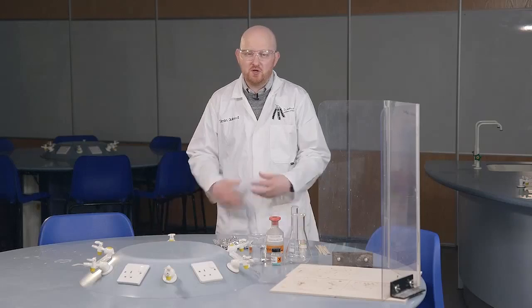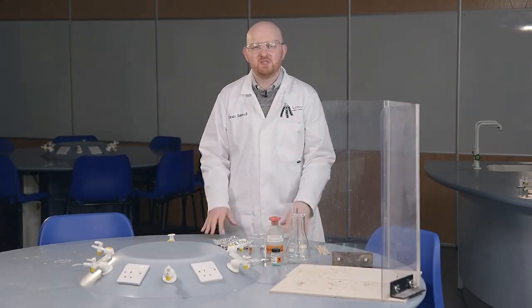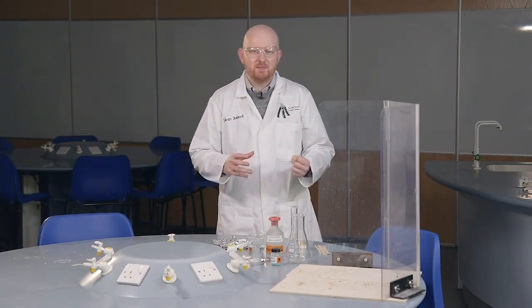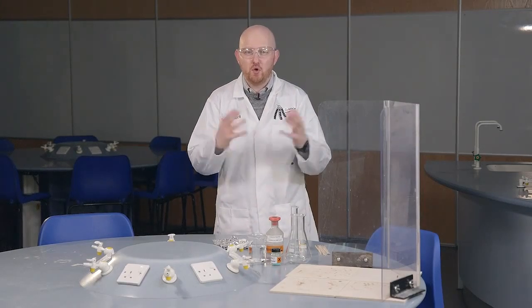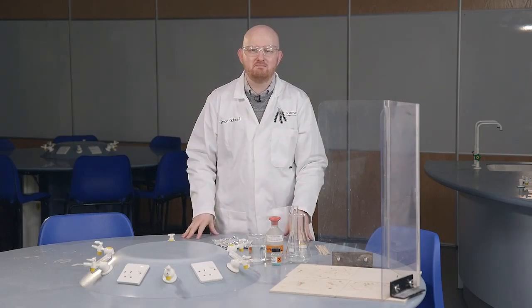Now, for our chemistry Christmas demonstration theme, we're doing Santa Claus is coming to town. So this is about his journey to your house. So when you're doing this lecture to pupils, it's about the journey of Santa Claus to their house for Christmas to deliver their presents, if they're good, of course. Now, with this demonstration, we're getting the Northern Lights going. So the Northern Lights are there to show Santa Claus the way, to shed light on his journey. Without them, he might get lost in the dark. So that's the premise for this demonstration, and to wrap it into our Christmas lecture.